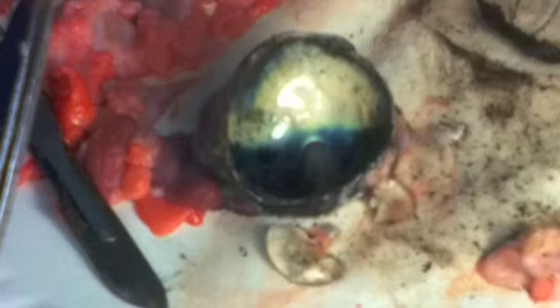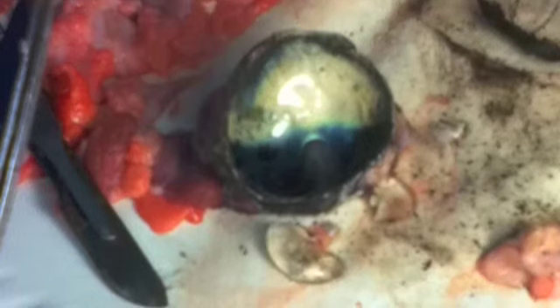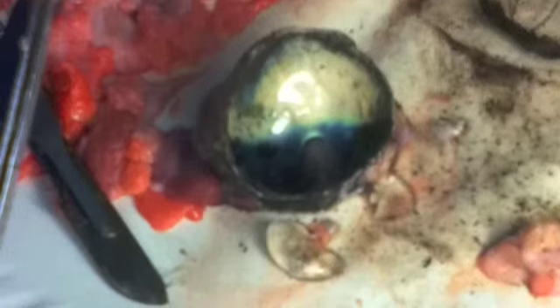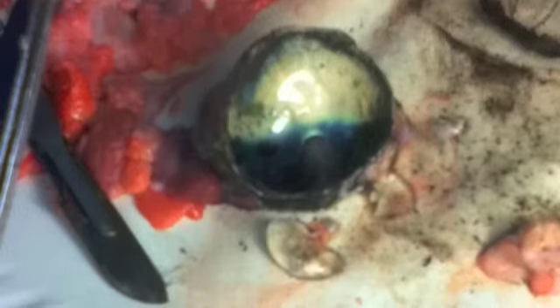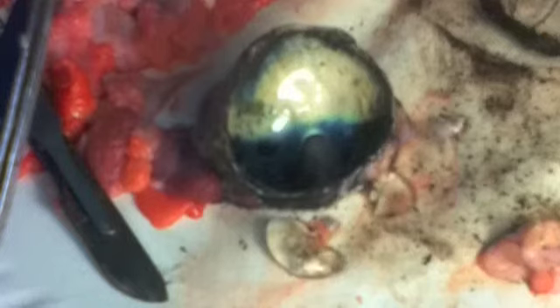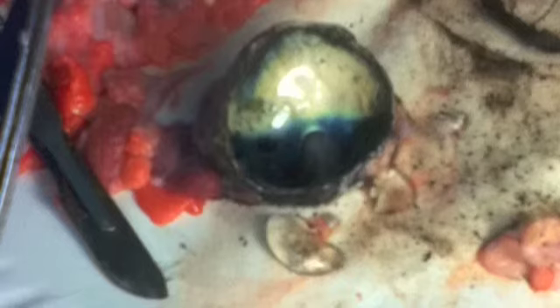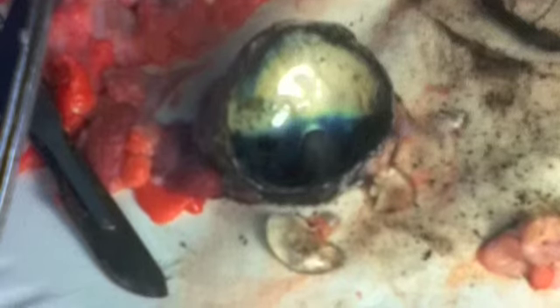When we take the rest of the vitreous humor out, we notice the shiny part on the back of the eye. It's called the tapetum lucidum, which reflects the light back through the retina, increasing the light available to photoreceptors. Many vertebrates have it, and it's useful for low light situations. Humans don't have this; however, we have a choroid, which is a thin pigmented layer that absorbs scattered light in the eye.